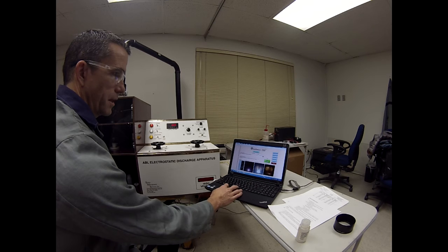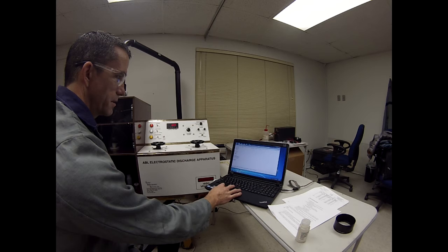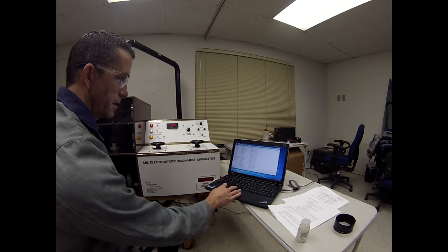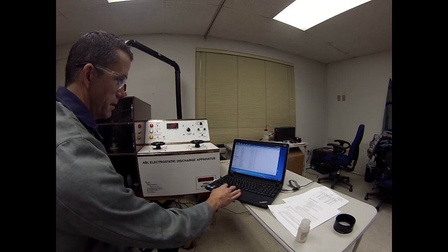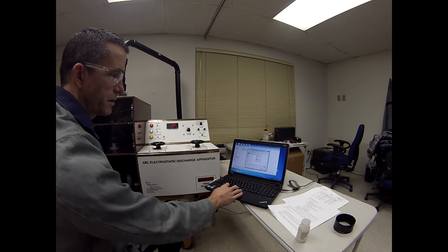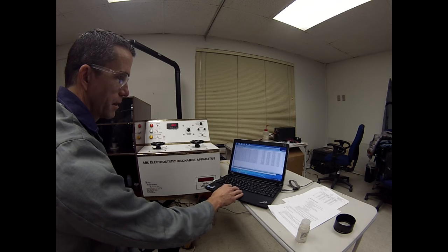So we'll stop GoDetect, and all of the files are under GoDetect data under the C drive. So C, GoDetect data, ESD. The baseline runs are under baseline, under silica sand. You can see all those. If you were to click in here like the last one we did, there's a baseline summary under 1500 millijoules. You can open it with Notepad. It will show you the file name, where it's located, the brightness, buoyancy, shape, uniformity, and color values.